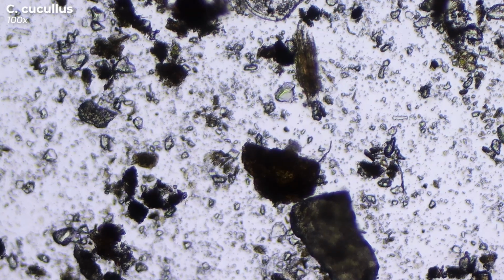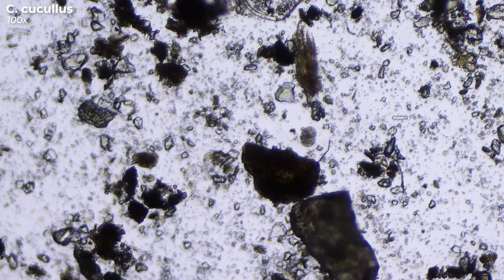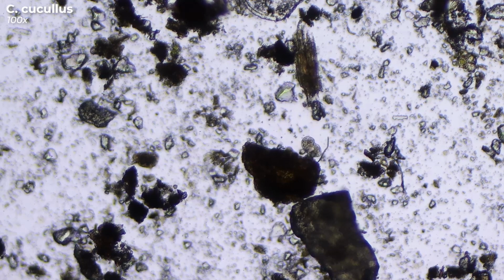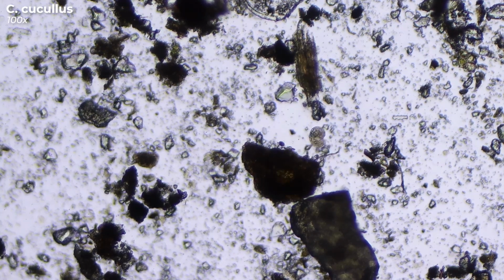These protozoa feed on bacteria, which are swirled to their cell mouth through a kind of funnel equipped with many cilia. Colpoda are found all over the world, but especially where they find a lot of food, so preferably in environments with high concentrations of bacteria.